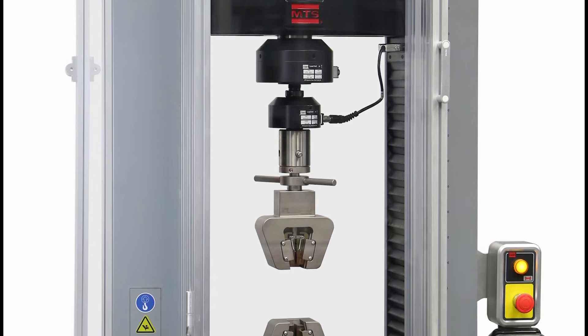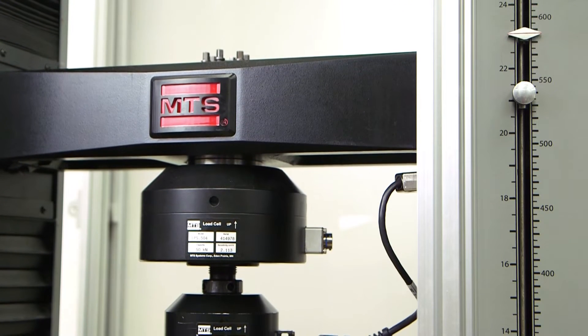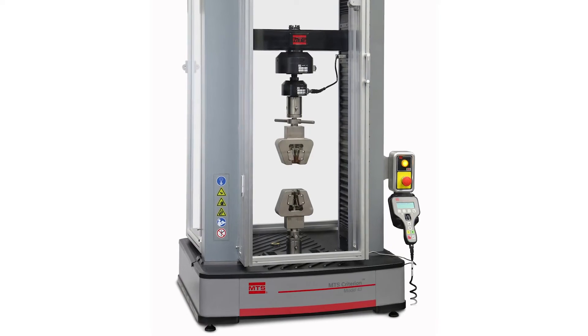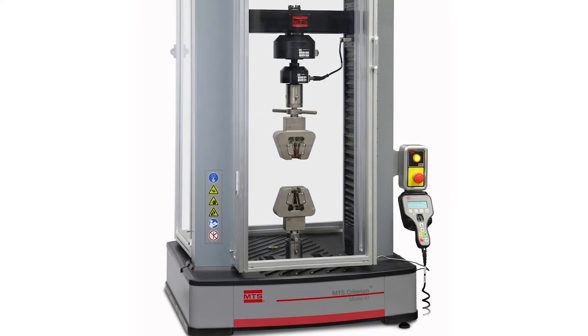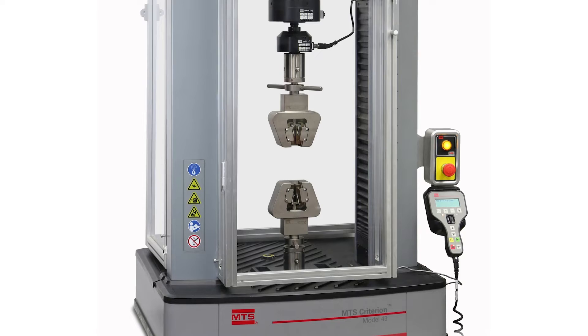A load frame houses the motor that will be creating the load that is transmitted to the specimen by moving the crosshead up on the support beams. Today we will be using an MTS Criterion C43504 load frame. This frame is capable of transmitting up to 50 kN.